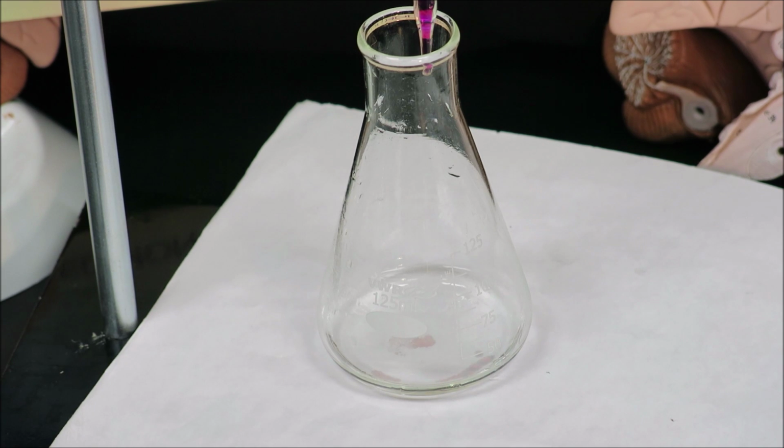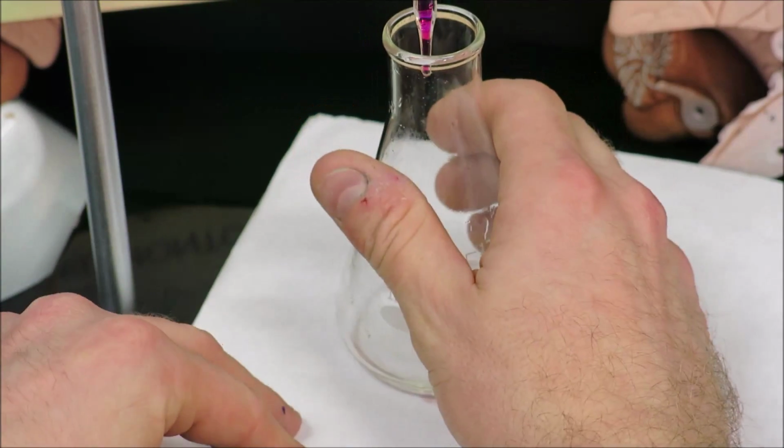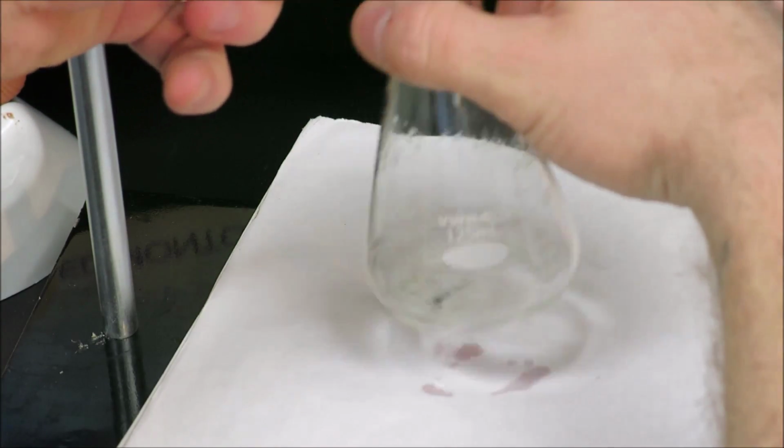Now, we're at 34 milliliters. If I add 14 milliliters to that, I'll get to 48. We have 50 ml burettes. So I do have enough to perform a third trial using this volume in the burette. So we are going to go ahead and start adding again straight out. We're going from 34, we're aiming for 48.